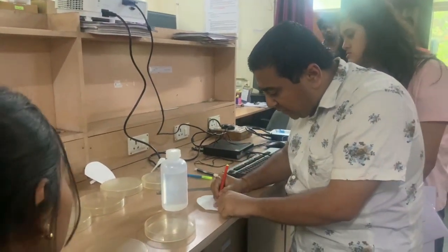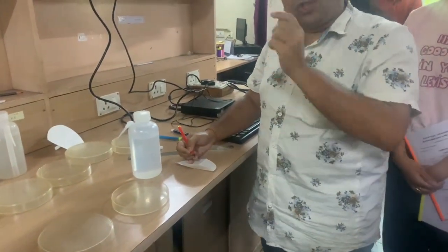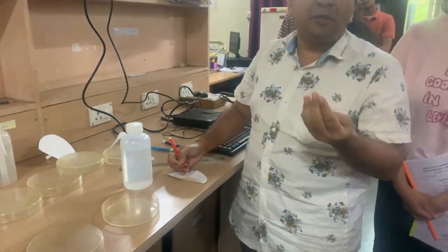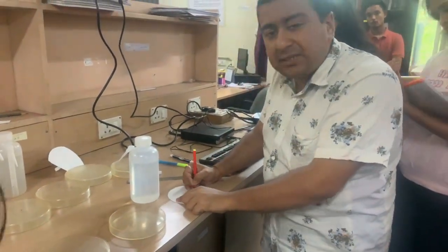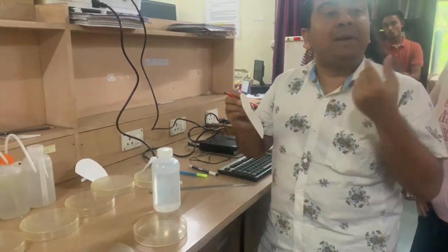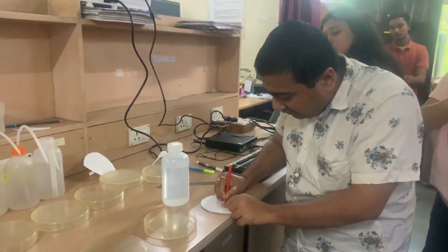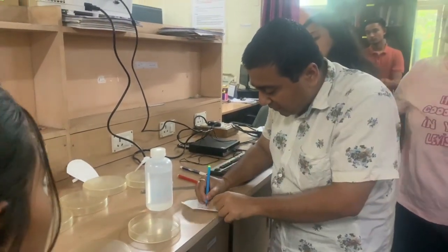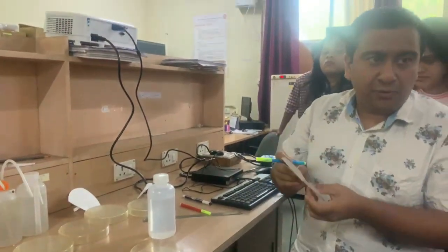Now what you do is, suppose you just mark along the circle in such a way that the spots are equidistant. For showing purposes, I am only showing you. You have to be very careful, because if they are not equidistant, then the samples will migrate randomly. So first you make a small circle with a compass here. That means you are creating a baseline, right? In that baseline, you create a circle, and then you simply mark here 1, then 2, let's say 3, and then 4. Now you will have to be very careful while marking.